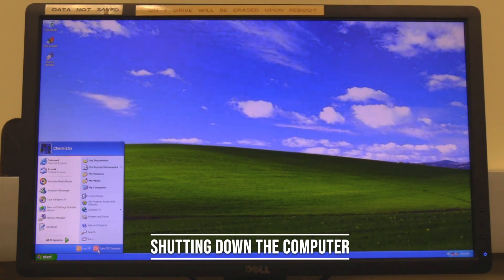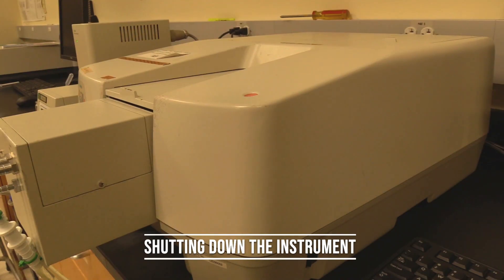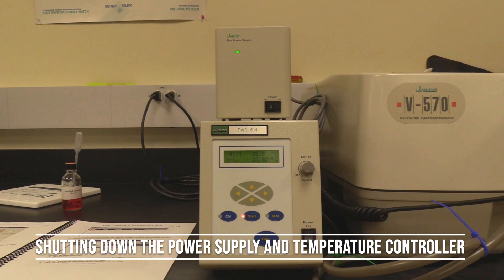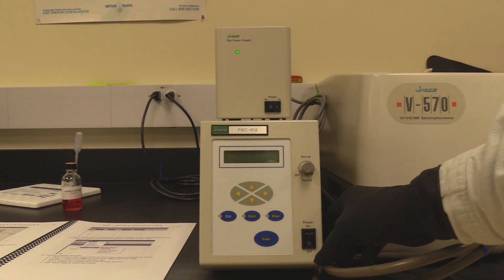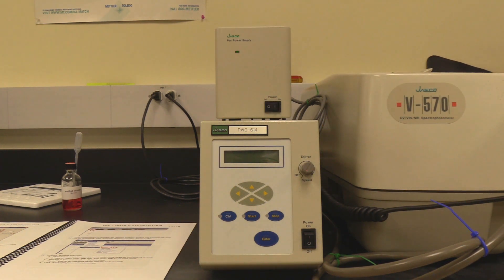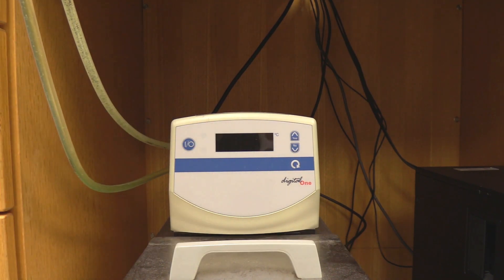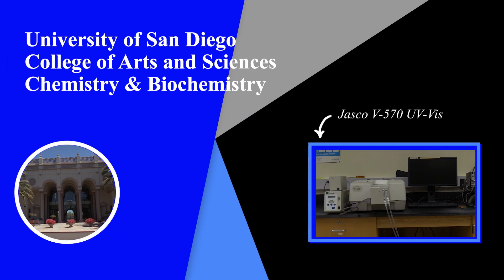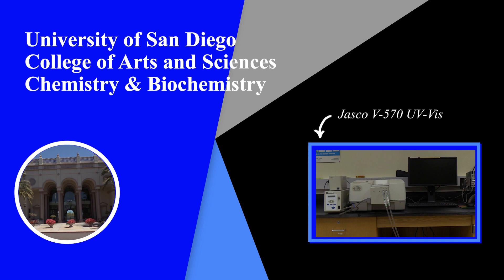Shutting down the computer and instrument. Close the software and spectra manager, then shut down the computer. Flip off the power switch on the right side of the instrument. The red indicator light should turn off. If temperature control was used, flip off the power switch on the bottom right corner of the temperature controller. The indicator light should turn off. Flip off the power switch on the bottom right corner of the power supply. The green indicator light should turn off. If temperature control was used, press the power button on the top left corner of the recirculating bath. The instrument SOP should be located next to the instrument. If assistance is needed, please look in the instrument SOP for the contact information of the Scientific Instrument Specialist.